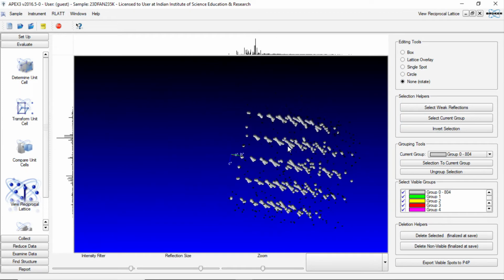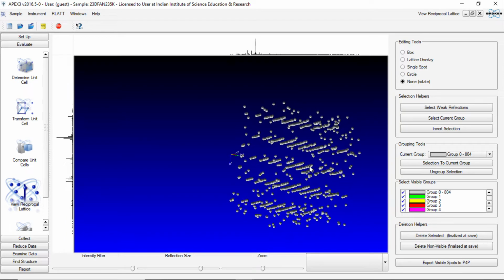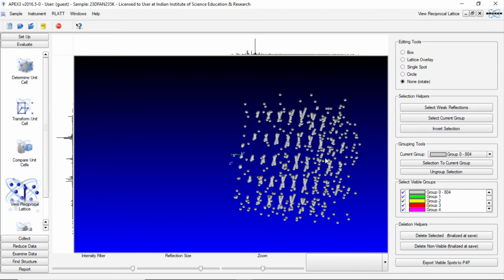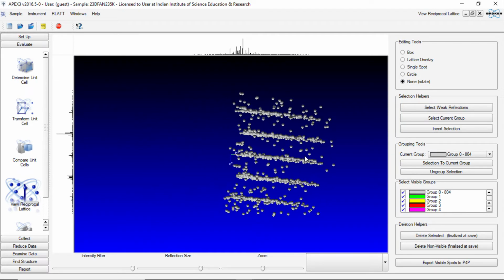Now what we see here is that if we do not have any intensity filter, there are two sets of reflections going like this, which essentially means there were two crystals in front of the X-ray beam and both were diffracting during this data collection. So what we need to do is to separate these two sets of reflections coming from two different tiny single crystals present in the beam. And this RLAT is a very efficient tool in doing so.